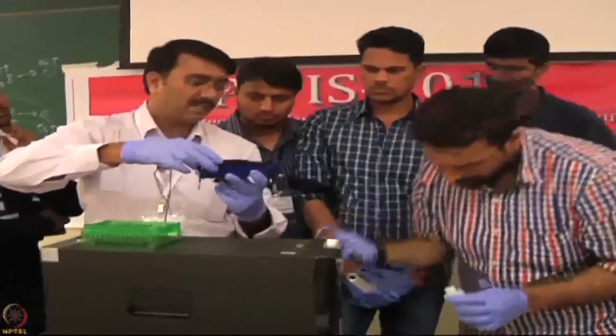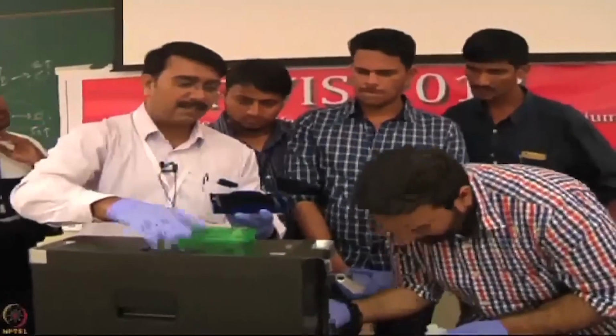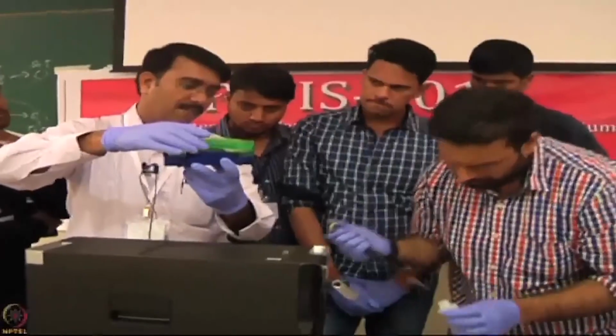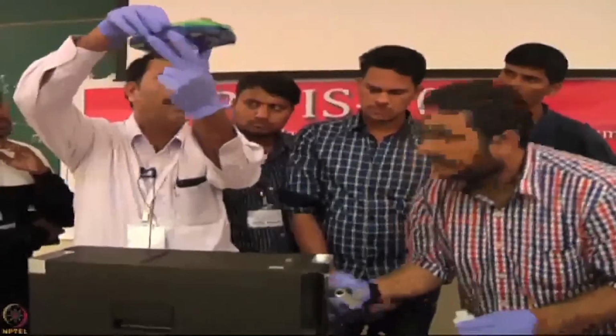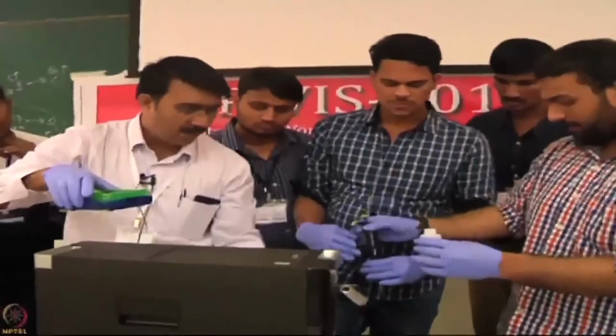So this is the sensor tray. This is a 96 well plate format once again. These are the 7 streptavidin sensors I have taken, and I am carefully putting them in like this. I did it up to G. Then you can add column 3.